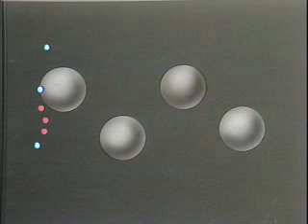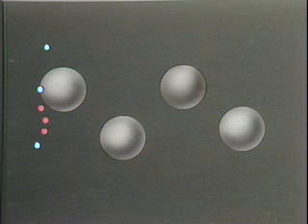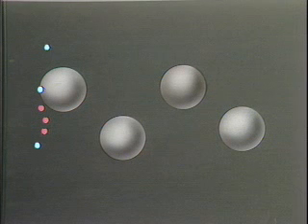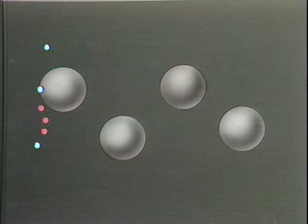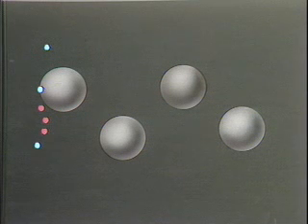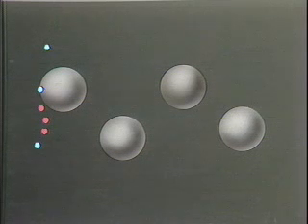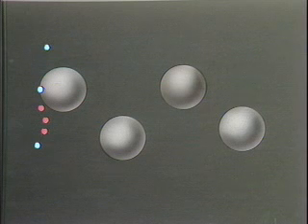The ratio of the amount of time components spend in the vapor, compared to the time they spend dissolved in the stationary phase, depends on the relative solubility of the components in the stationary phase. However, as the remaining vapor is swept along through the column, it will also dissolve in the liquid phase and will temporarily establish an equilibrium between the liquid and vapor phases at this point in the column until the vapor molecules are again moved further down the column.